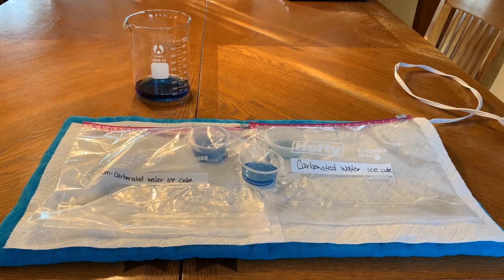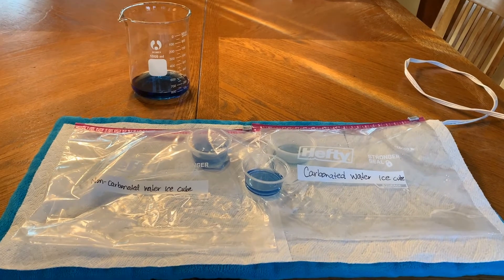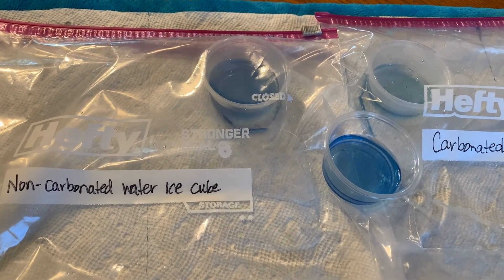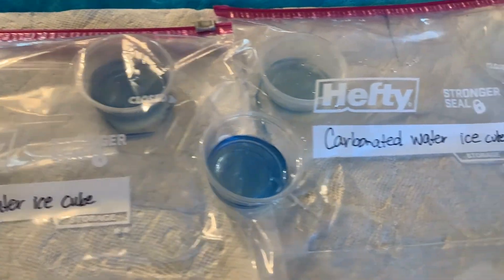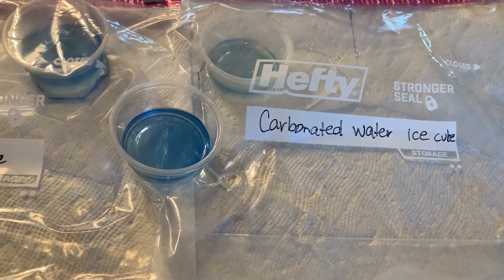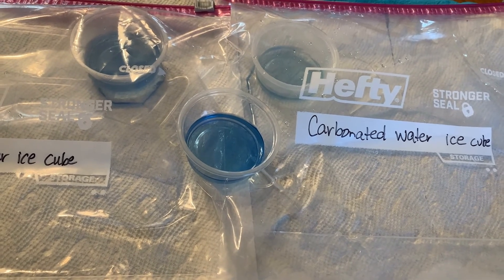Our experiment has been sitting for about an hour. Let's check and see if we've seen any changes to the BTB in each of our baggies. The baggie on the left had the non-carbonated water ice cube, and the baggie on the right had the carbonated water ice cube. The BTB in the front is from out in the classroom. Do you see any evidence that gas can be trapped in ice?